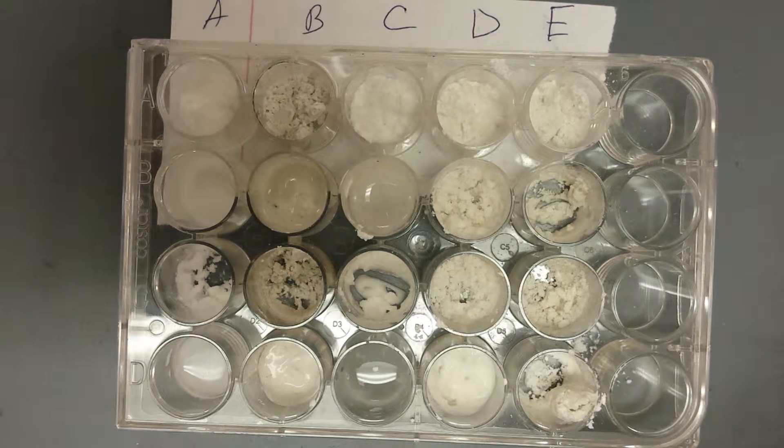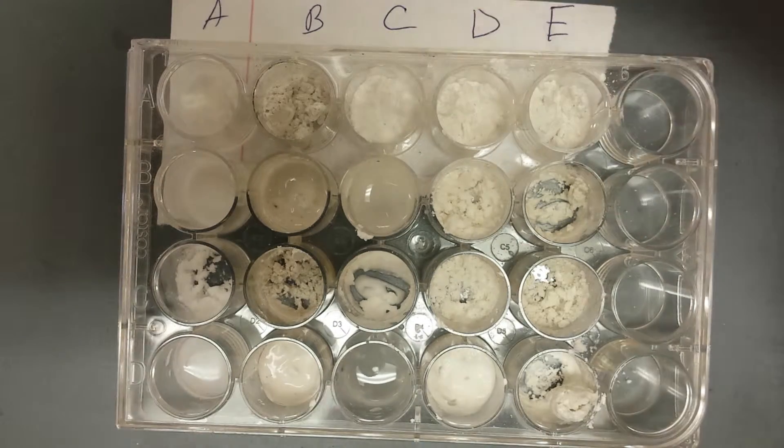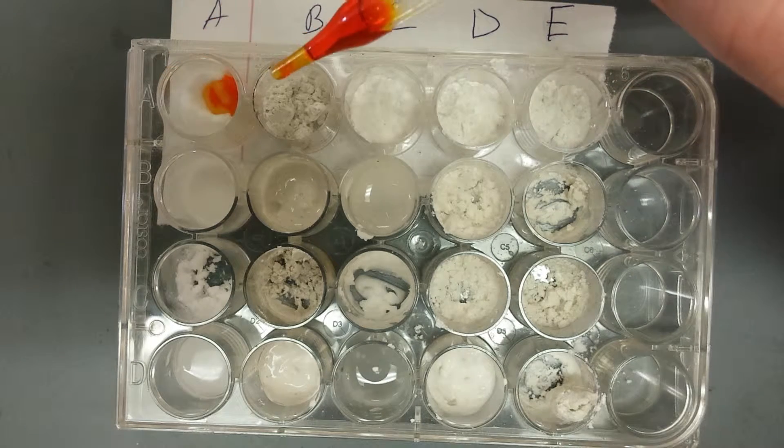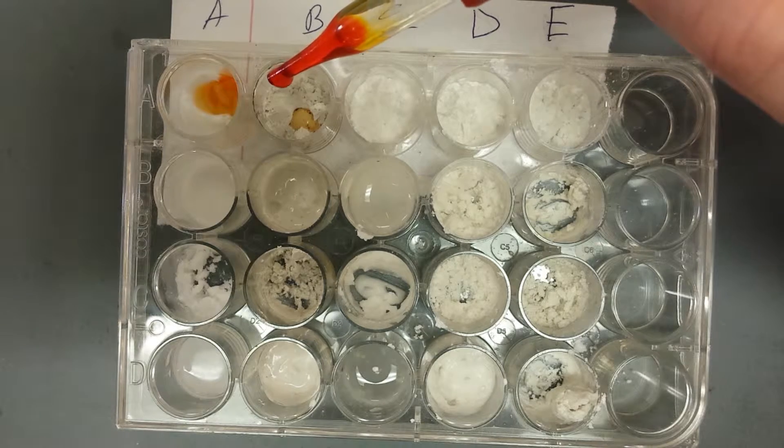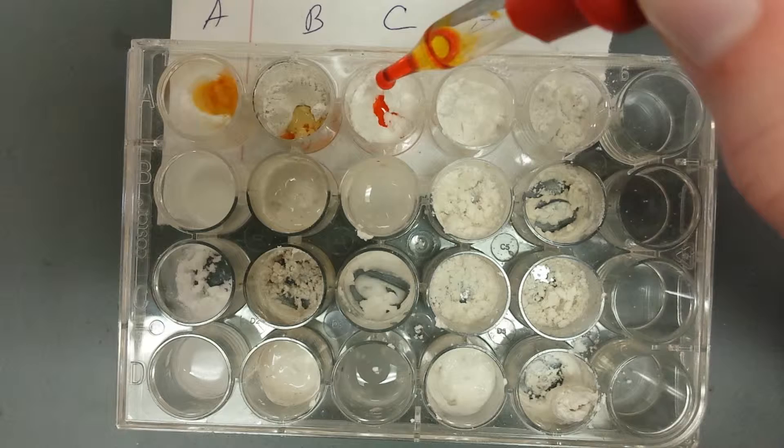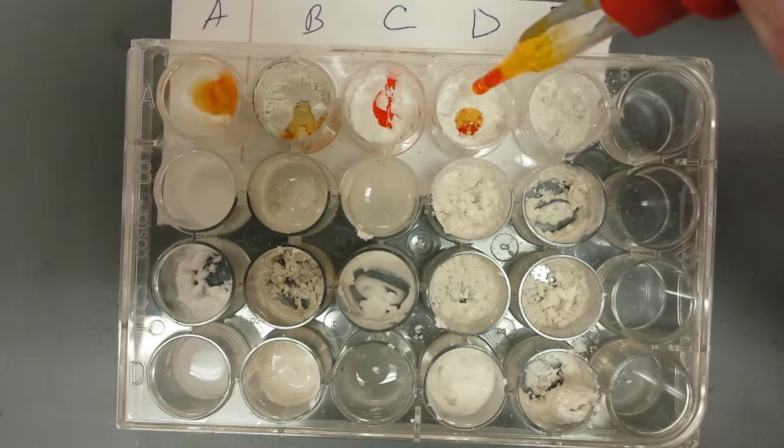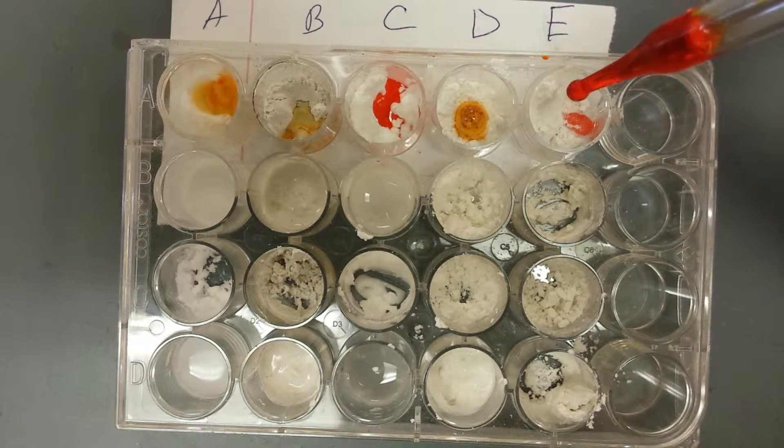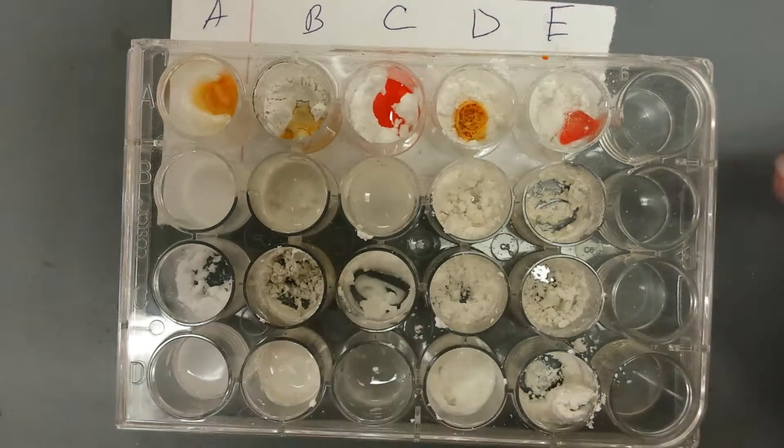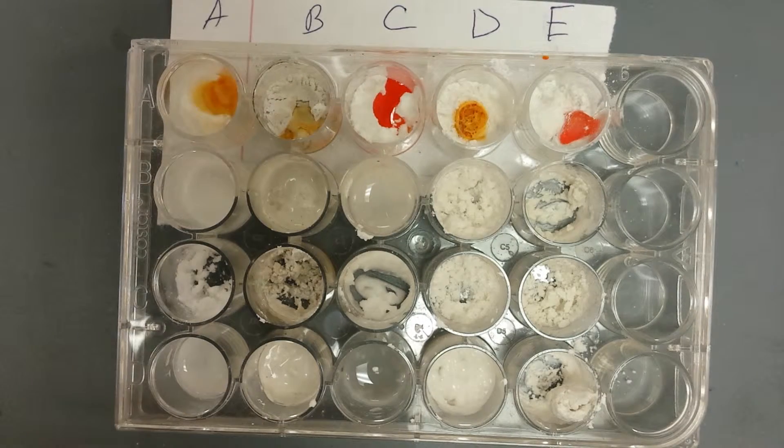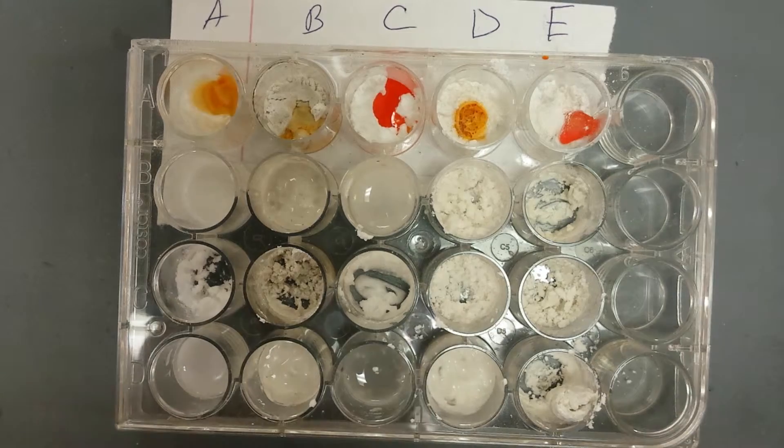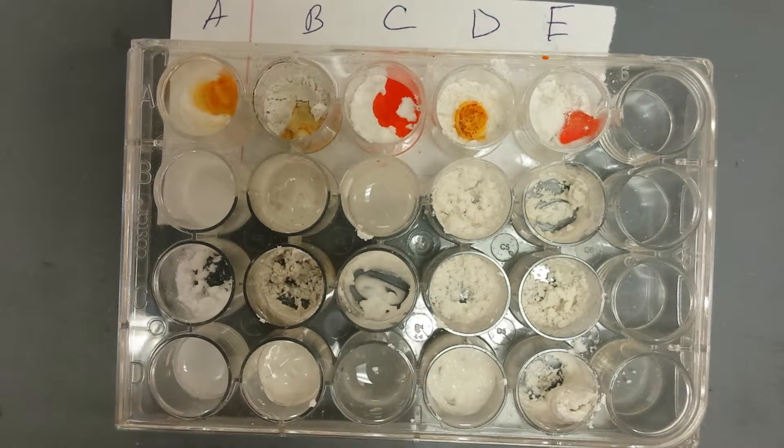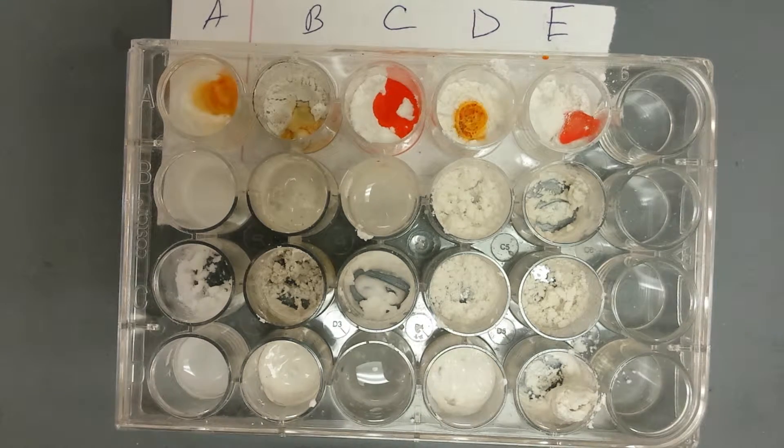You can just... do two. Whoa, that one's fizzing. Look at that! Look at the indicator to the C. E, D, E, I mean. E, or C, or D? E. It just kind of, it's like just kind of sitting there, just clumped together. Okay, so D fizzed. I think I might want to watch that one over again, and we should go one at a time that time. Because look at them, they're all way different this time. They are. Because look what D, look at D. Okay, look at D right there. Yeah. Here, we'll just pop this out and pop this in.